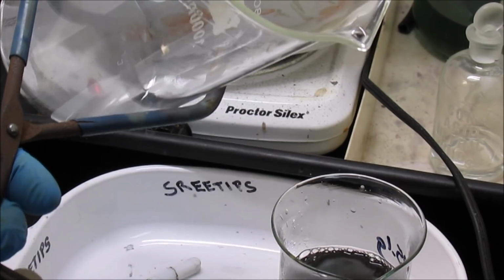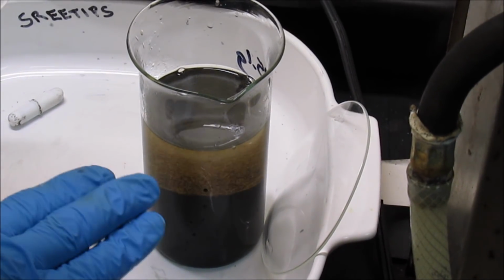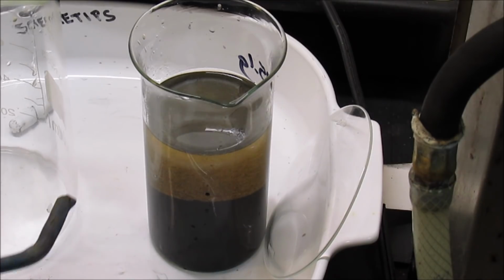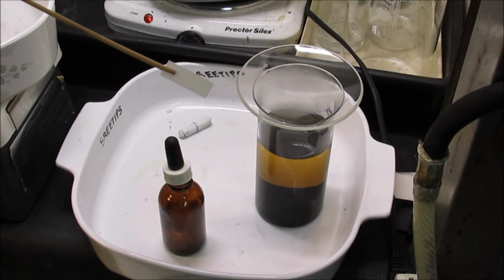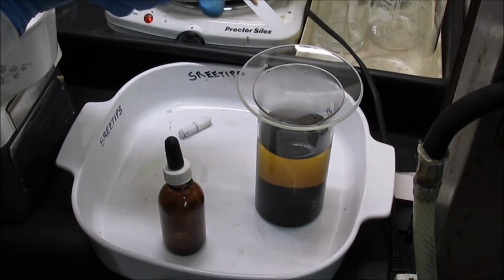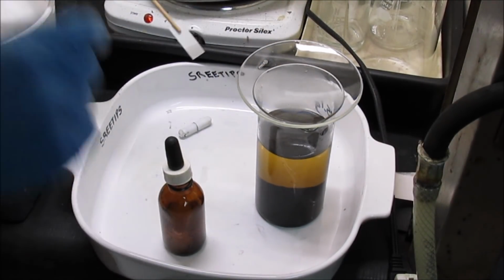See how fast that's settling now? That's what I want to see. All the solids are just drifting down to the bottom of the beaker. I can probably go ahead with the tests on this solution now. First thing I want to do is a stannous chloride test here. It's a piece of filter paper on the end of a bamboo skewer. Make sure we don't have a whole bunch of precious metals in solution.